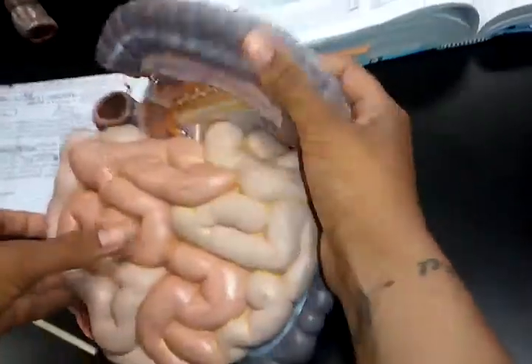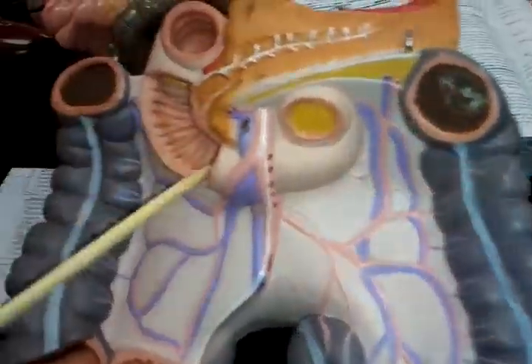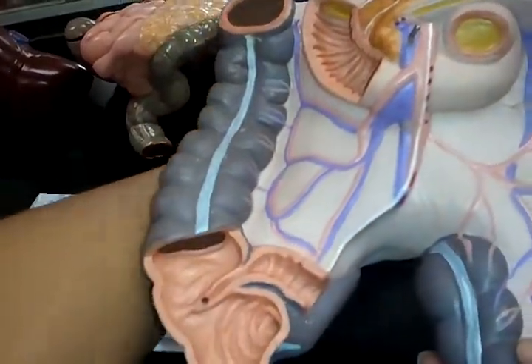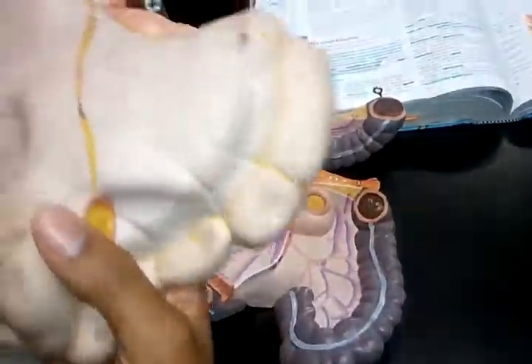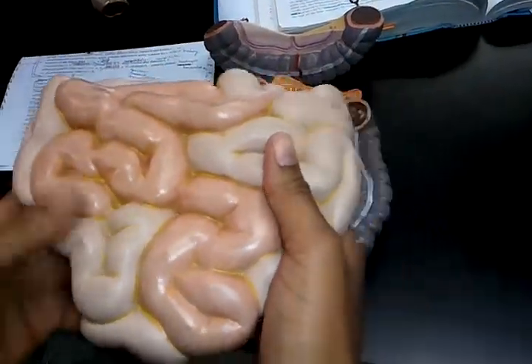So now I'm going to open this right here. And this right here is the villi. The microvilli are microscopic. So then I'm going to go to the mesentery now. This right here is the mesentery — it's what holds them together. And the lacteal is also microscopic.